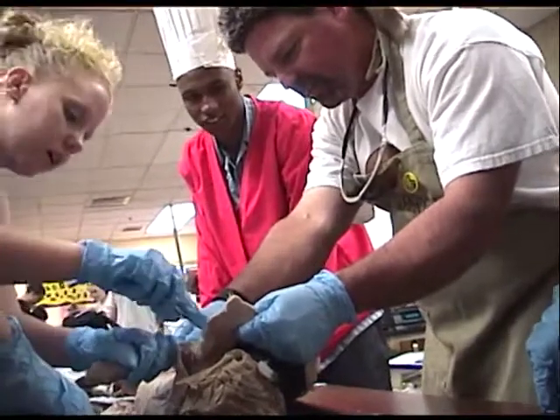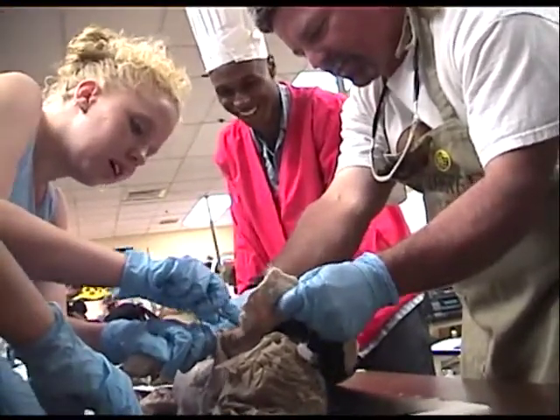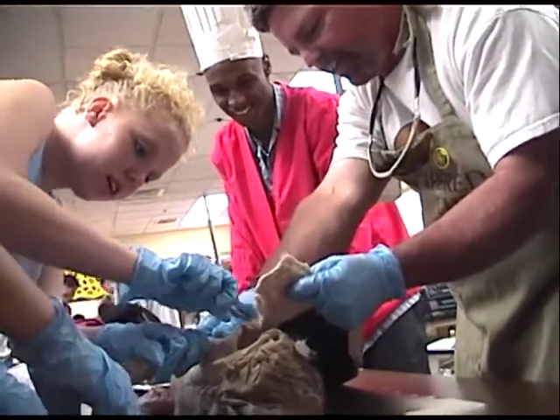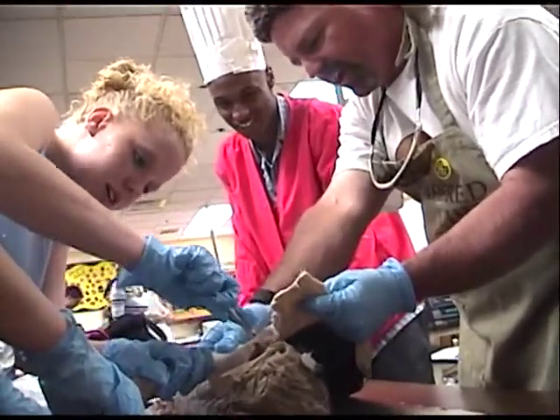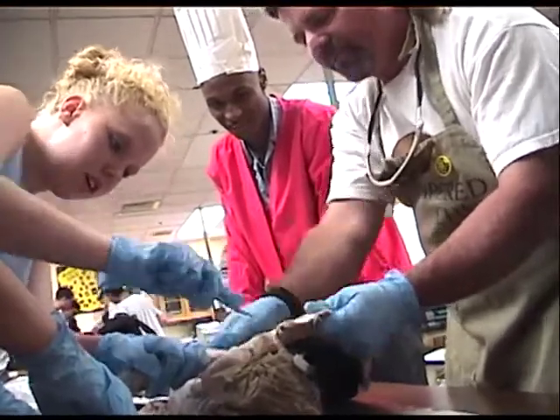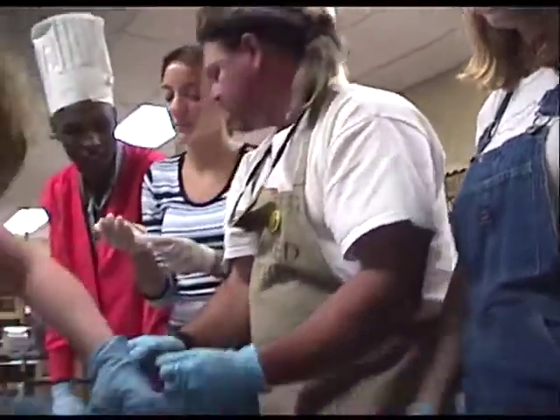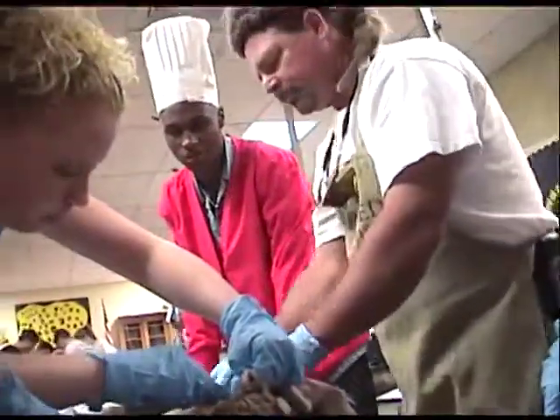Alright, cut that right there. I'm not comfortable ripping. There you go, keep going. See? You're getting that fascia out of it. See? That's just real thick. What is fascia? Remember, it's a covering — between the muscles, of the bone. Look at it. Go ahead. It's a bone.